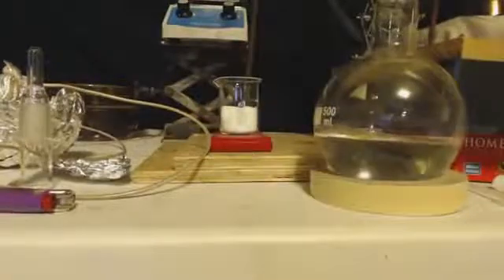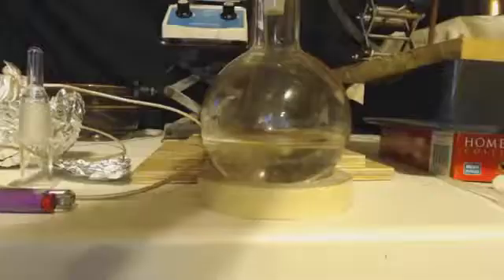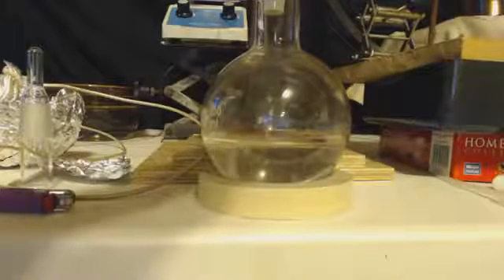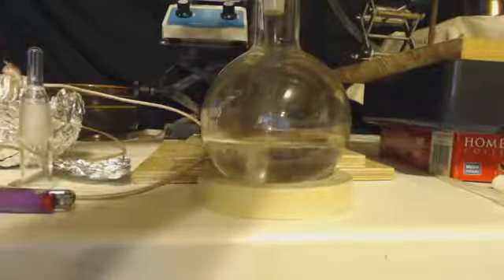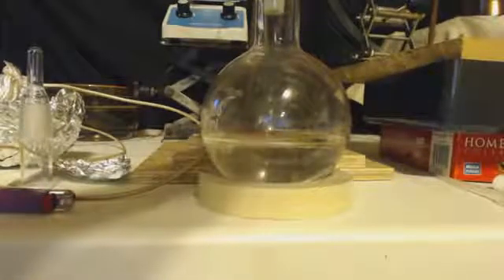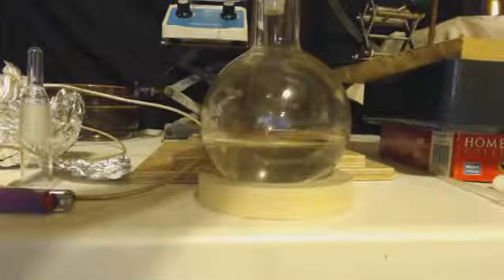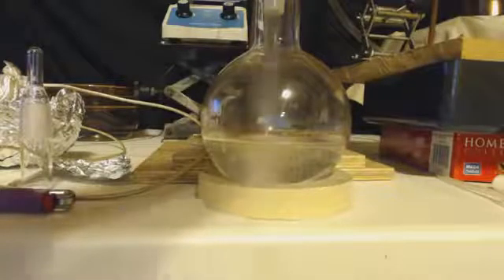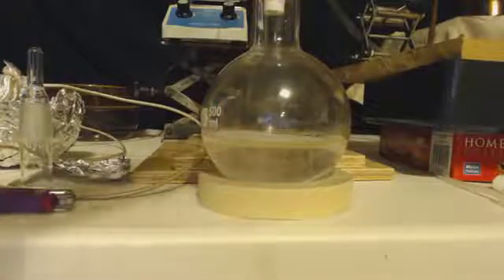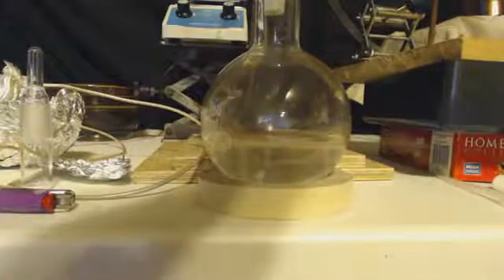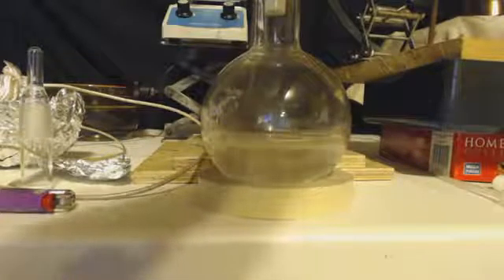I did do this experiment again, kind of. What was left inside the pot, I just took it and I got another half mole of sodium bromide and I put it into the pot. Now this pot, a lot of the sulfuric acid and ethanol is gone, it's dilute acid. And so it's not obviously going to give me a good product, not a good yield. So I put it in there and just like before, I'm going to distill out between 38 and 78 degrees. I'm going to wash that with water, cold water, then get the acid out with some sodium bicarbonate, and then wash the water out with salt water, getting 20 milliliters. Now that would be a 54% yield on the sodium bromide. So obviously that's a terrible yield. But like I said, the acid was real dilute by then, and I just wanted to see what I would get out of it.